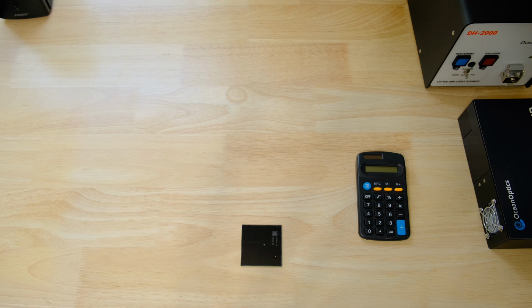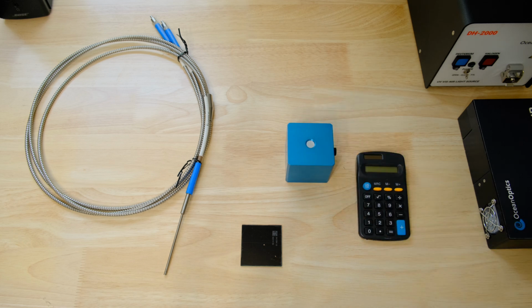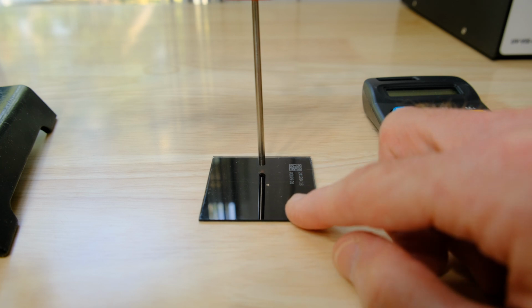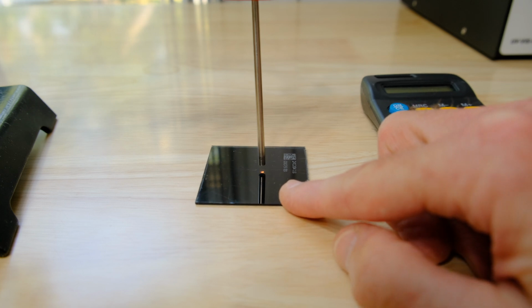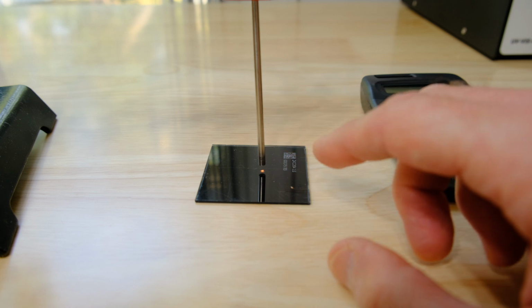The two main methods of taking a reflection measurement include a reflection probe or an integrating sphere. And each one of these has their own pros and cons. The nice thing about a reflection probe is that it gives you exact control over the specific point of your measurement. So you can find a problem spot, like right there, and take a measurement just on that point and ignore everything else around it.